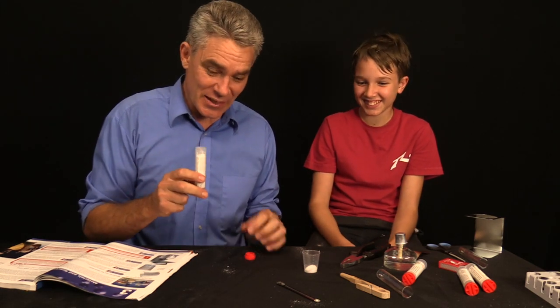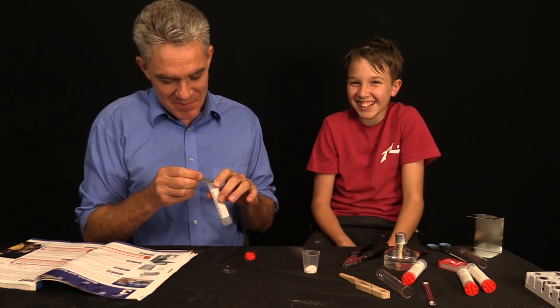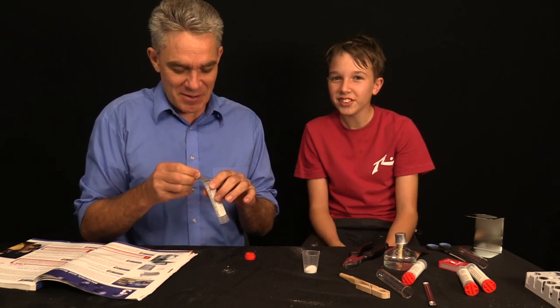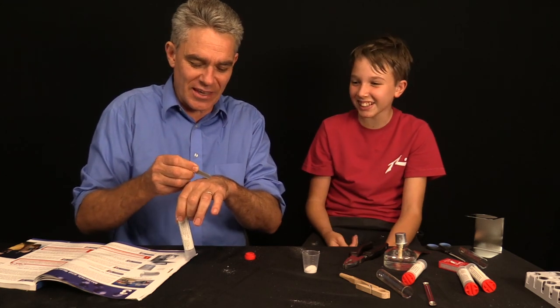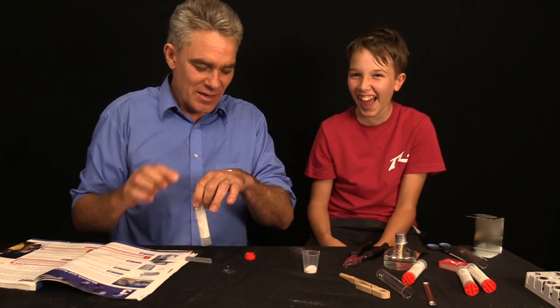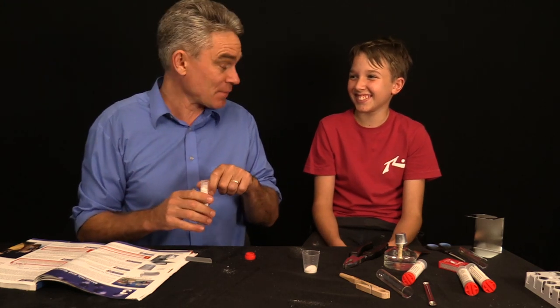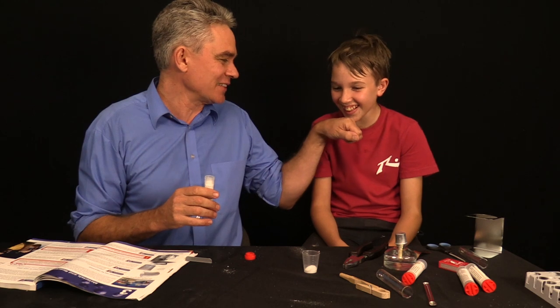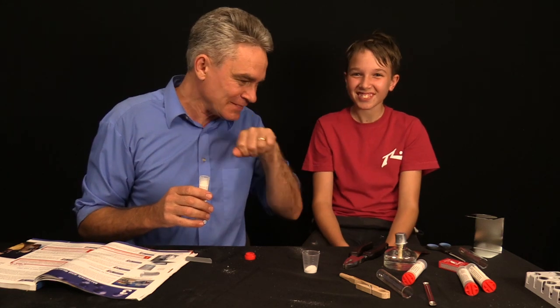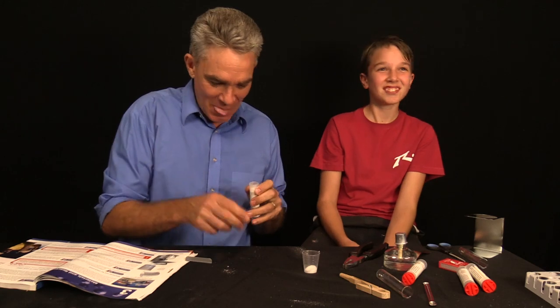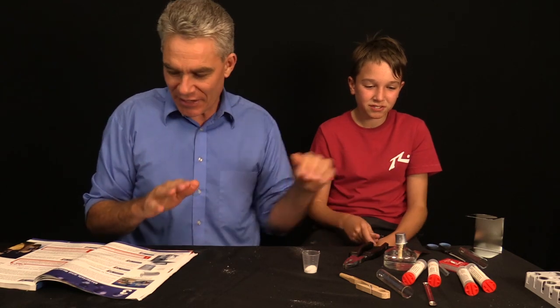Now I'm not recommending that you eat chemicals out of containers. Don't do that. But Sam, do you want me to try it? I'm going to put some on the back of my hand. So definitely do not eat chemicals that you get out of chemistry kits, like this stupid guy. But I'm pretty confident that... Mmm, that's ammonium chloride. Have a taste. It's a real zinger. Don't do that. That's a bad example. Definitely a bad example.